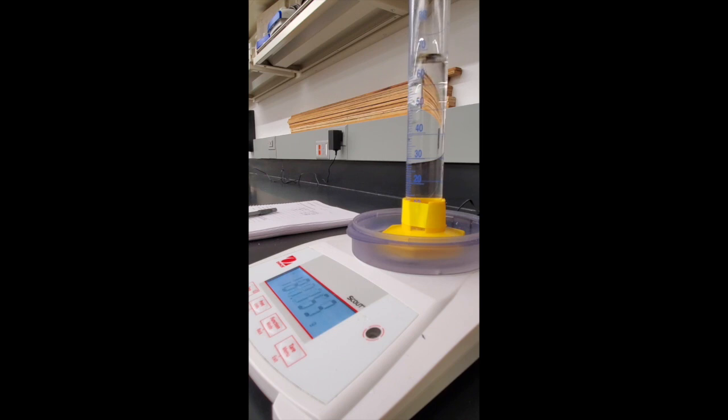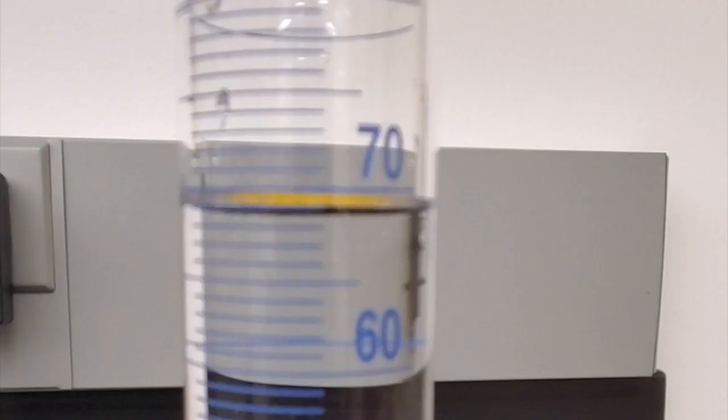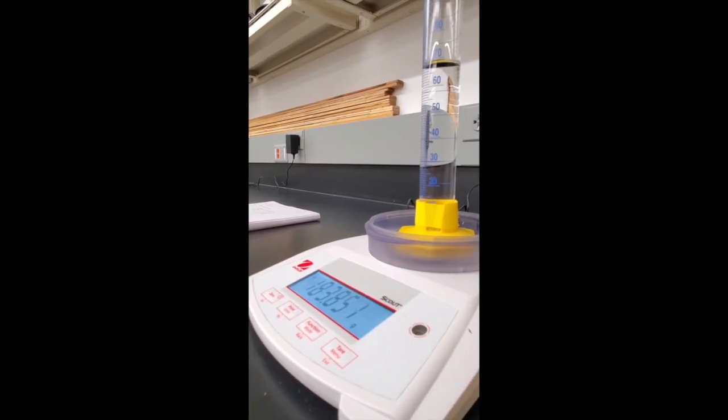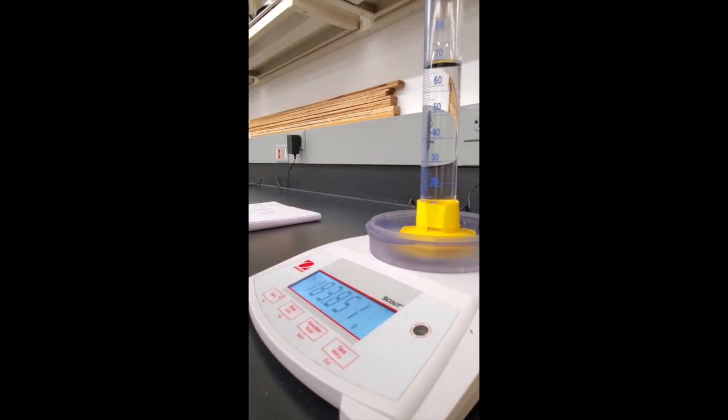Again, we continue to add solution A. The new volume is 69.0 milliliters and the mass is 183.851 grams.